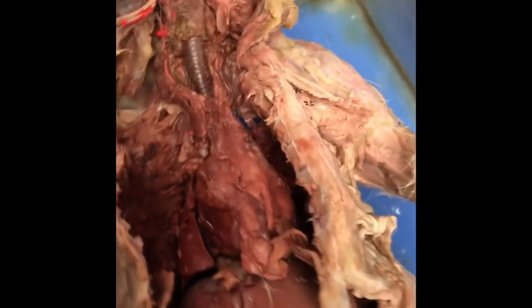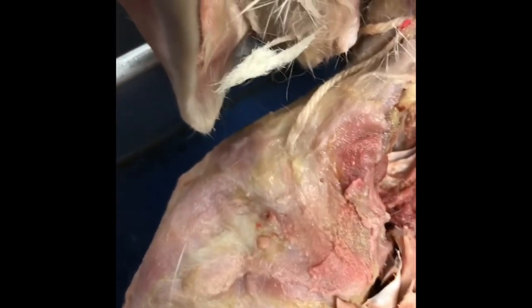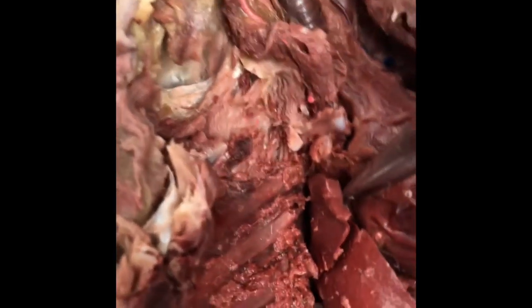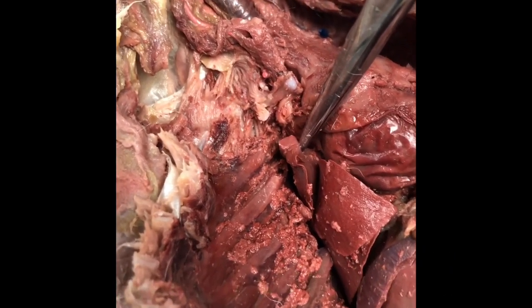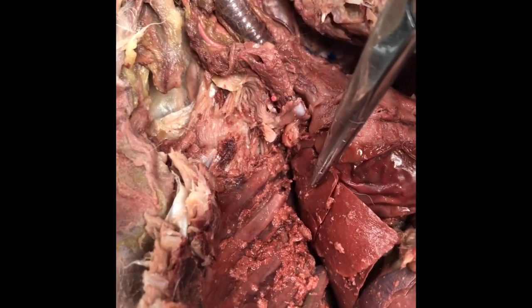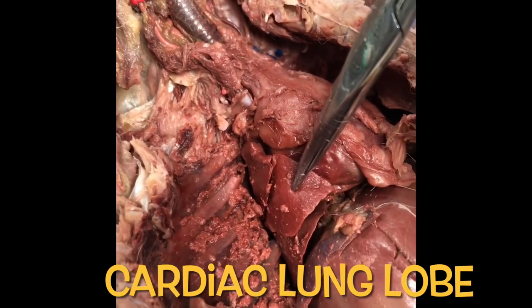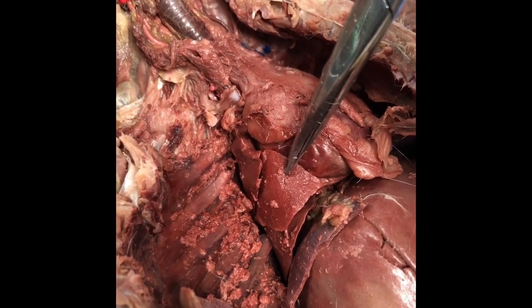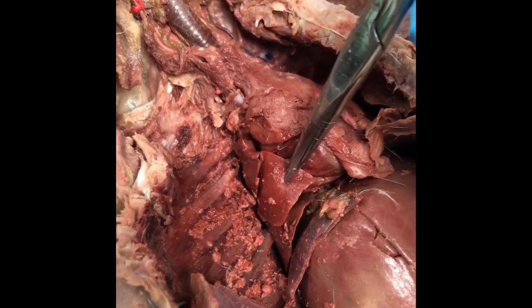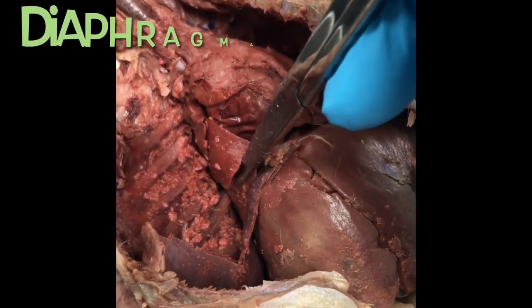Now we're going to make our way down to the lung lobes. The chest has already been opened and we are going to go through the lung lobes, starting with the apical lung lobe at the top. A capital A makes kind of like the top of a mountain — it's the top of the lung lobes. Then the cardiac lobe is in the middle, off to the side of the heart.